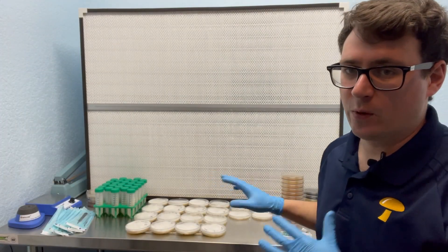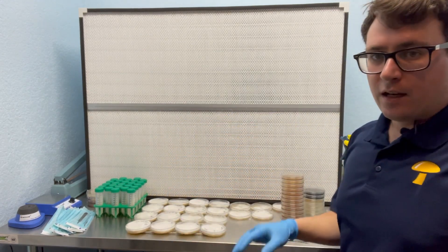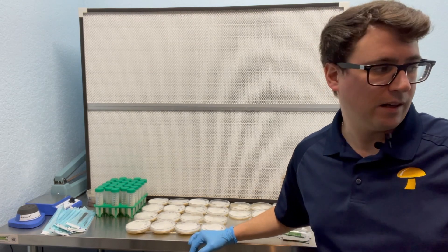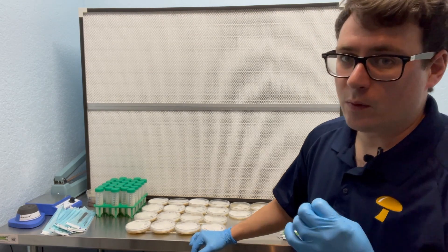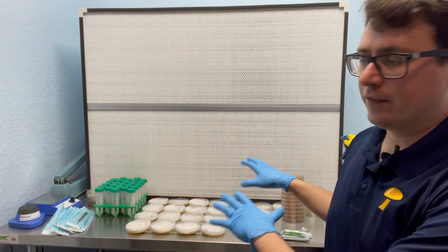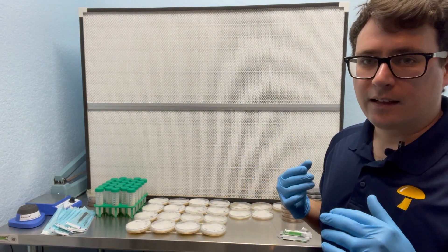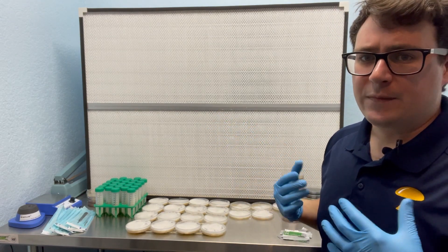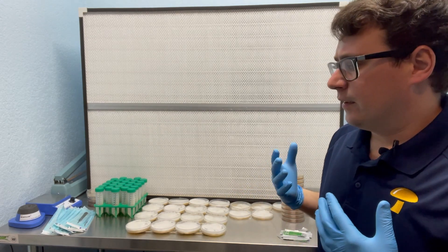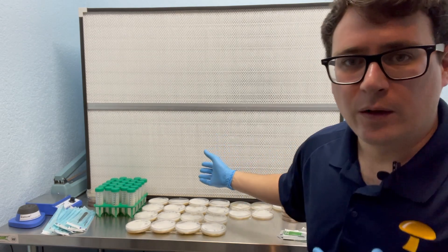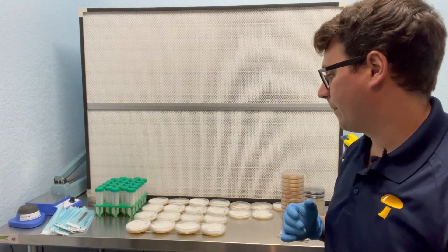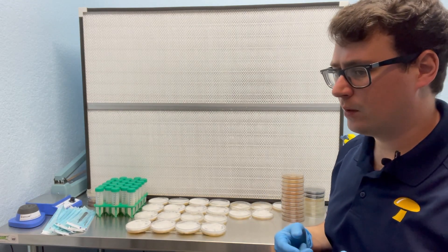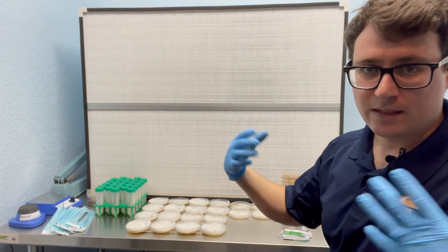But that's what I prefer. I'm not sure if that's the best practice, but I'm going to be taking my sectors from that really thick banding where the two colonies meet. Okay I've got my work station set up like so. Usually I do this kind of work in my vertical flow hood but it's completely filled up with different liquid cultures. So I'm going to work in front of this flow hood and it's always good to just see from multiple angles and different methodologies for using a horizontal flow hood versus a vertical flow hood.